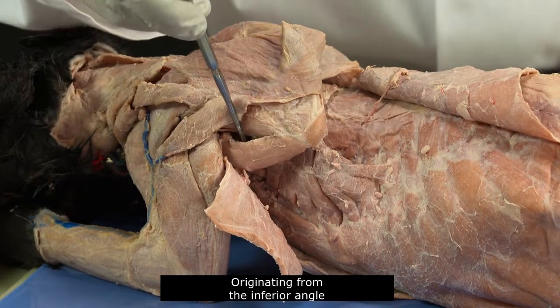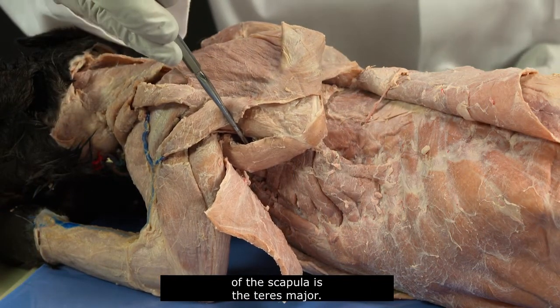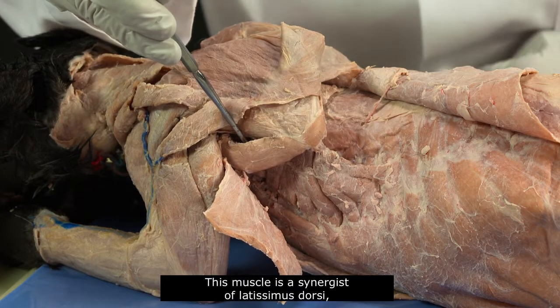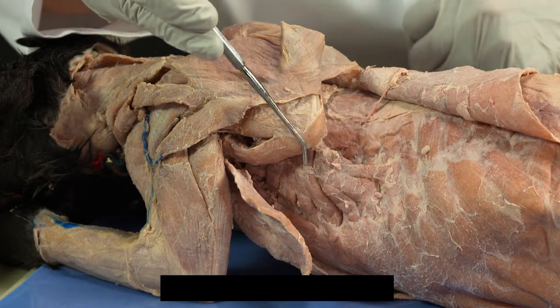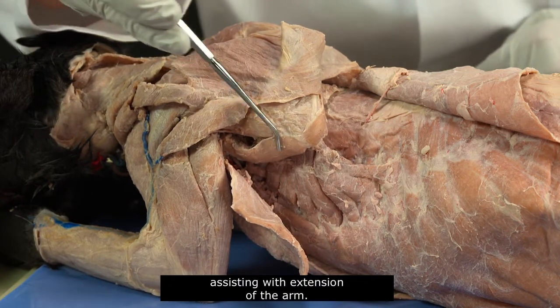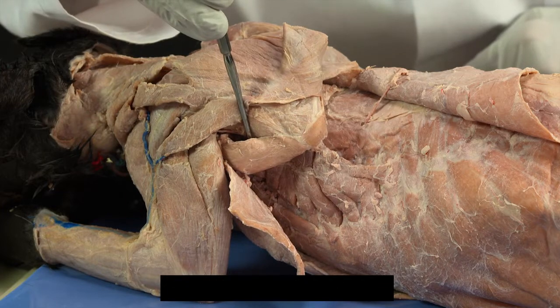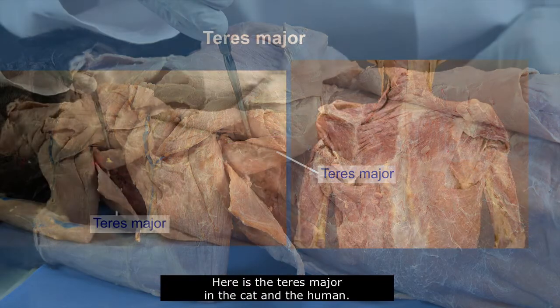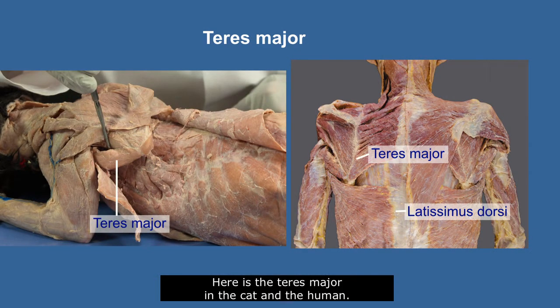Originating from the inferior angle of the scapula is the teres major. This muscle is a synergist of latissimus dorsi, assisting with extension of the arm. Here is the teres major in the cat and the human.